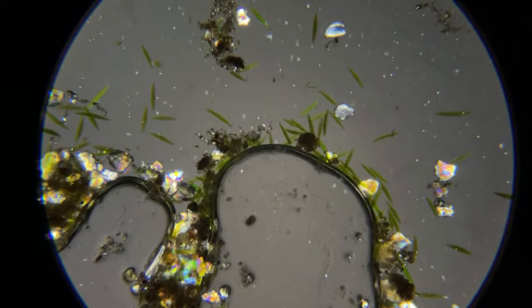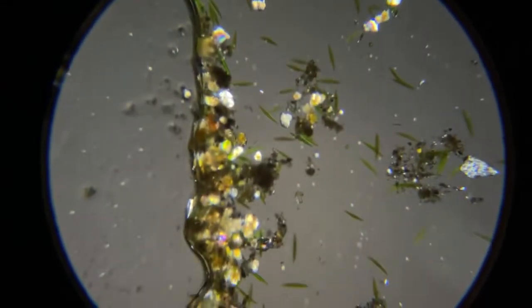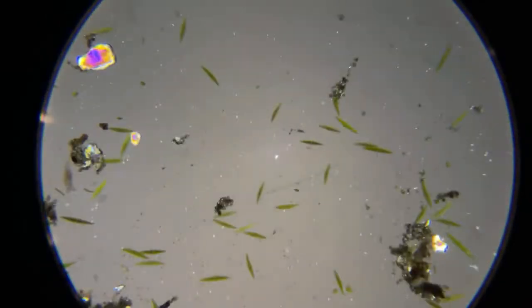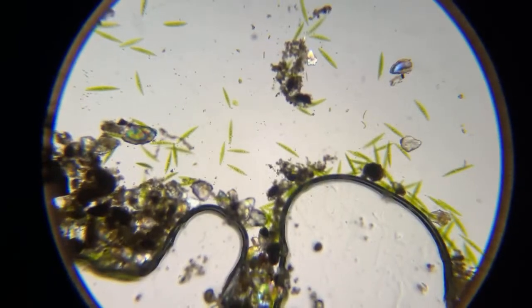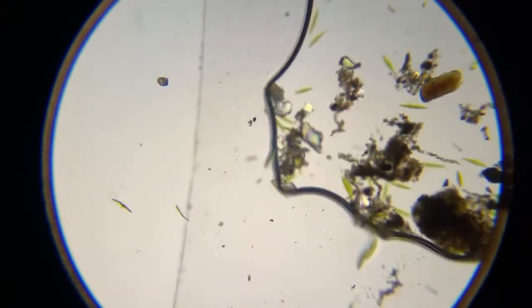So let's see. Oh, I took my eyes off for a second. He's gone. Where'd he go? I hope he didn't come out of the water and get on my leg or something. I lost him. Let me jump out of polarized light real quick. And whenever you zoom out like this, for some reason, YouTube takes control of my iPhone.